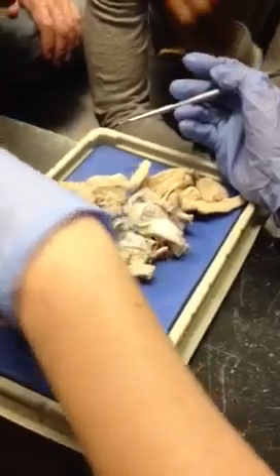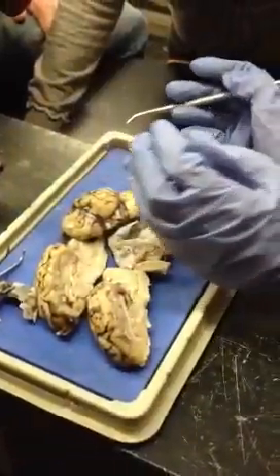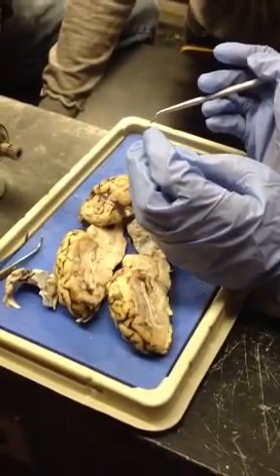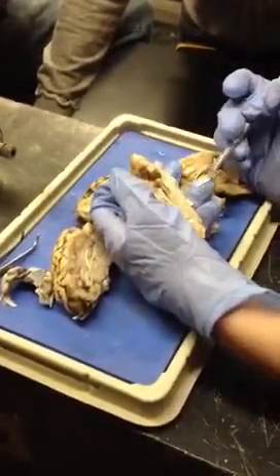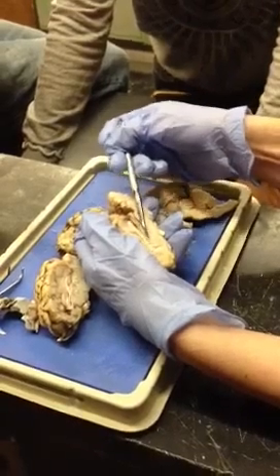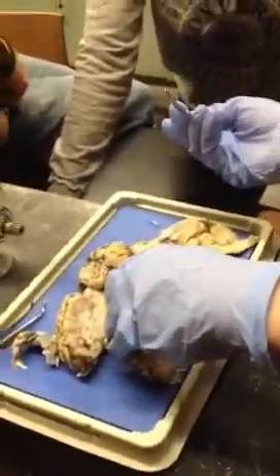Then, so we can't see the epithalamus from that? The epithalamus is tricky because it's also formed by the walls of the ventricles. So it's going to be, I mean, this is it, really. But it would make a lot more sense to show it to you if you had cut a brain this way. You know what I mean? Because the epithalamus is like the roof of the third ventricle, basically.